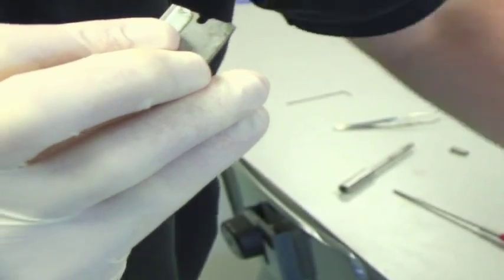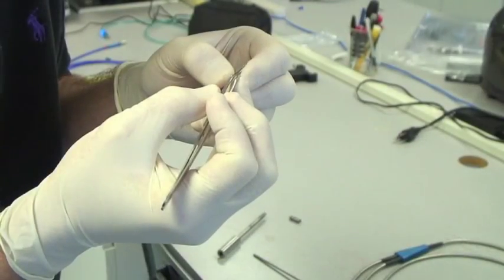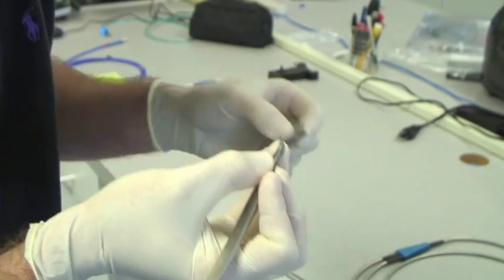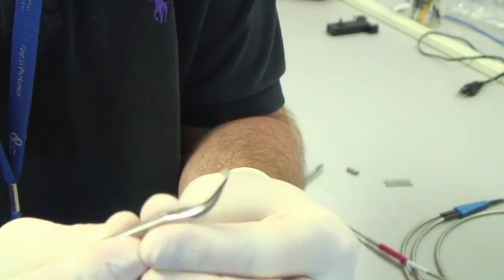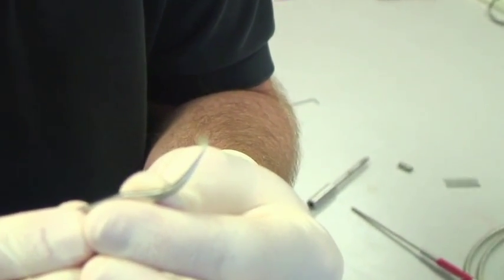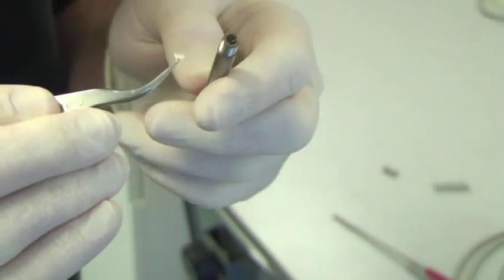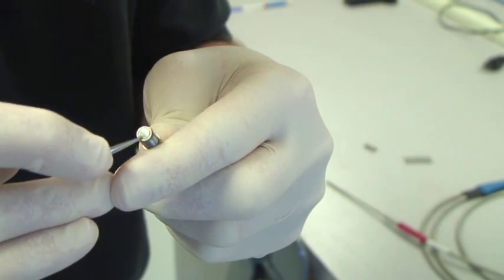Now you can discard this white piece as trash, so get rid of that. But you'll notice that there's still this piece of transmissive - it's mainly green patch. We're going to stick that with the sticky side down onto the tip of the probe here.